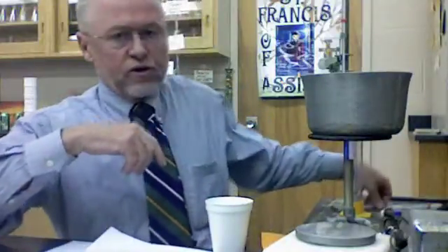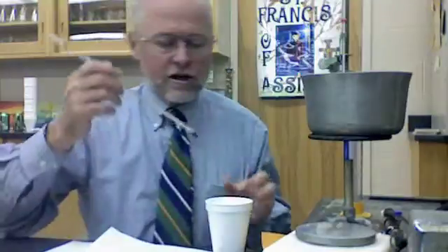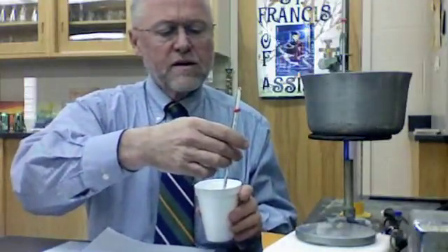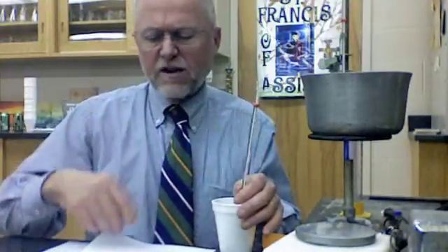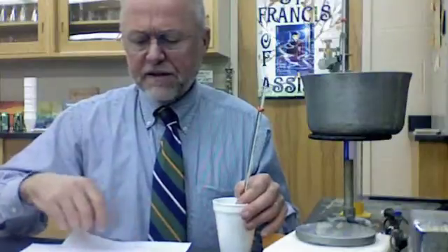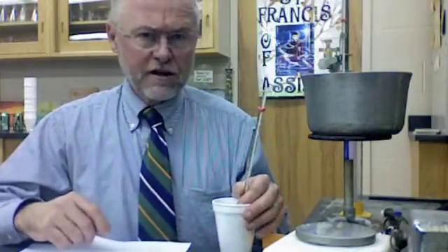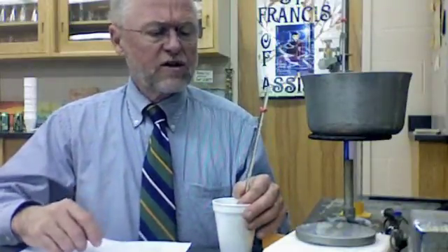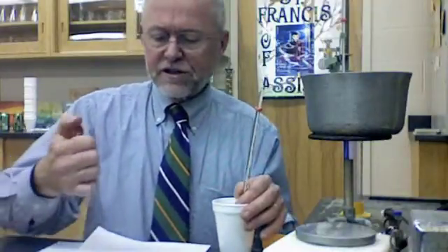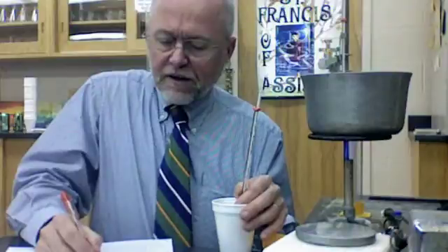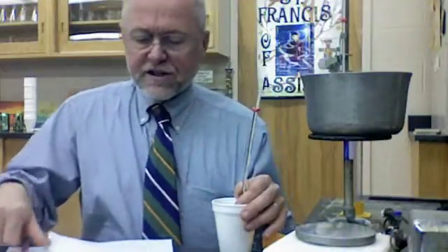And I have to take the temperature of this water. Of course it came from the tap so it's going to be about room temperature. This is going to go under TIW for initial temperature of water, and that happens to be 23 degrees Celsius. 23 degrees Celsius is the initial temperature of the water.